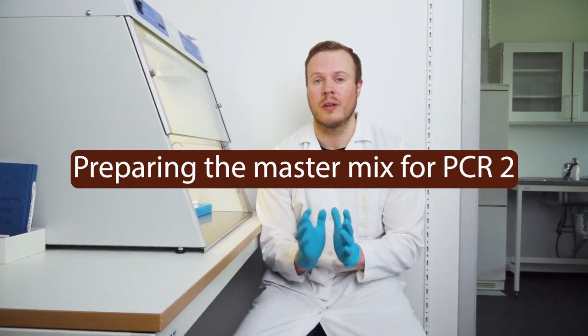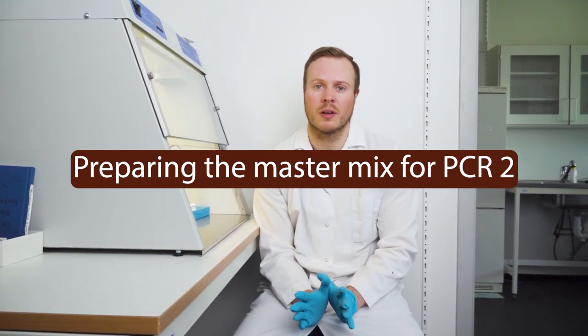Okay, so now we have done the magnetic bead cleaning of our PCR products from PCR-1. We also run from one to two gels depending on how you want to do it. And now we are going to do PCR-2.